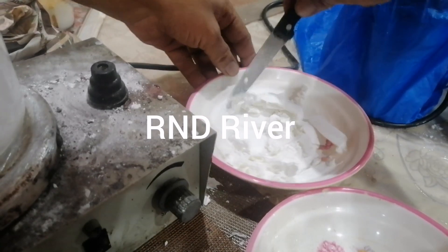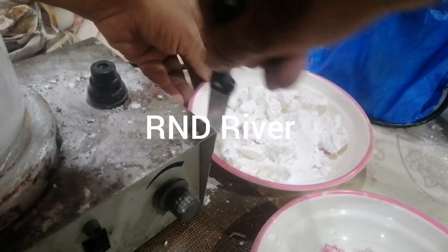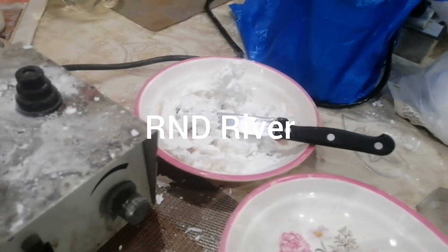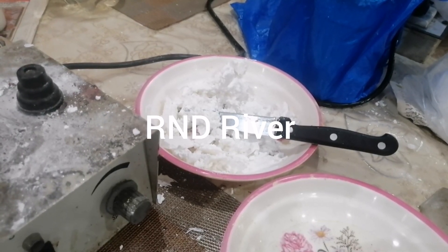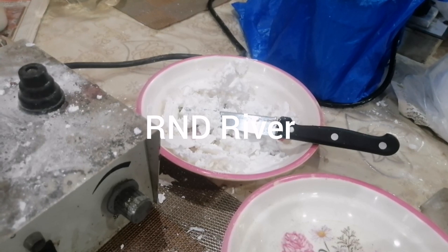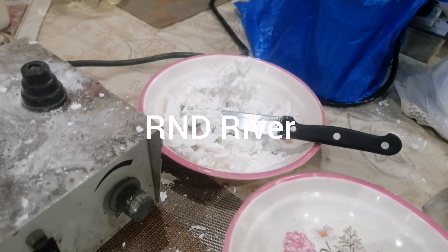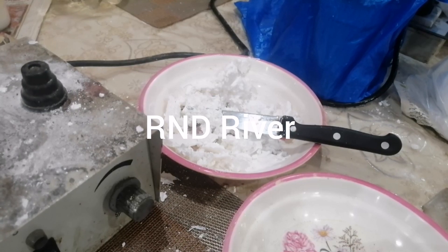After the product is finished, you have to grind it in an impact or pulverizer machine to a very fine mesh — up to 200 mesh. The product will be bulky but lightweight. It will take some time to cool because it was very hot. As the product goes down in temperature, it becomes just like a frozen solid, and then it should be ground in an impact or pulverizer up to 200 mesh.